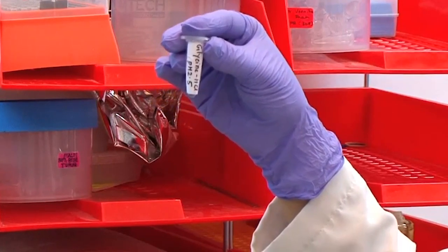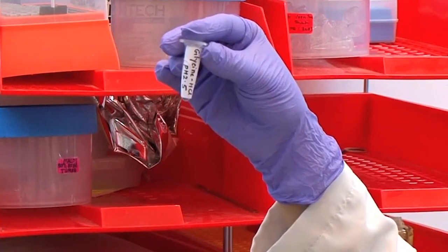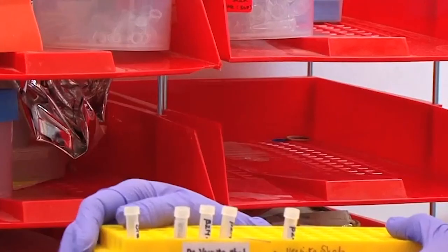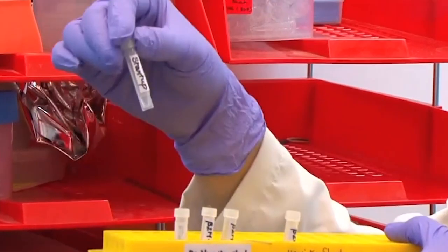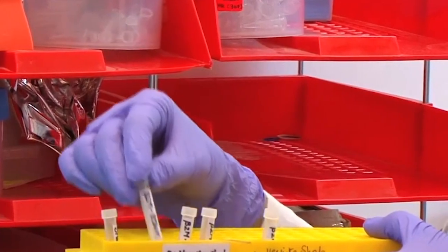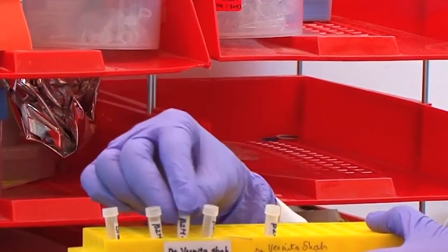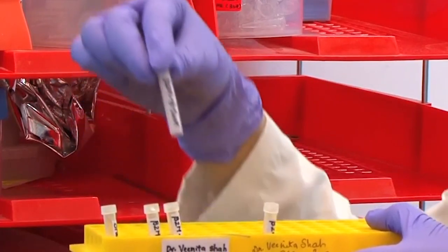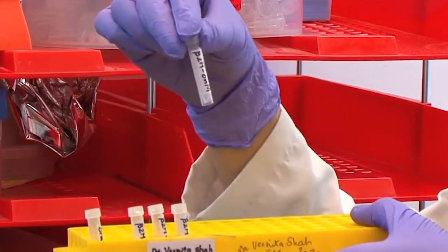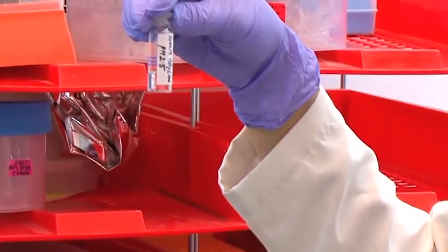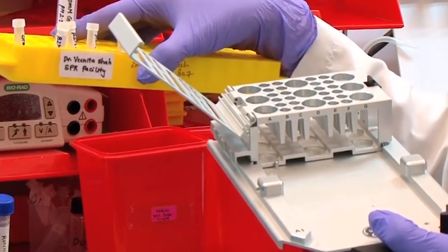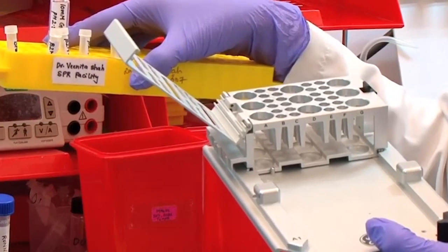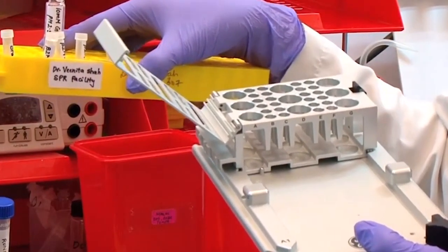For the regeneration of the surface, we have prepared glycine HCl pH 2.5 as the regeneration solution. We have transferred all the solutions in the specialized tube starting from the startup, beta 2M concentrations starting from 85 nanomolar, 42.5 nanomolar, 8.5 nanomolar, and 0 nanomolar. The regeneration solution is placed in this glass vial. We will now insert these tubes into the appropriate rack and then into the system to start with the binding analysis of anti-beta 2 microglobulin with beta 2 microglobulin proteins.